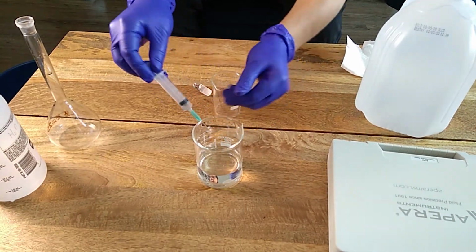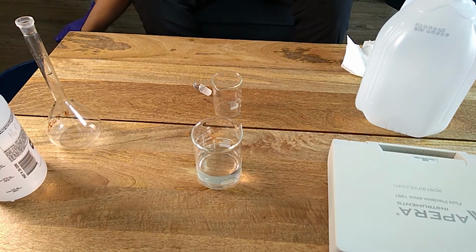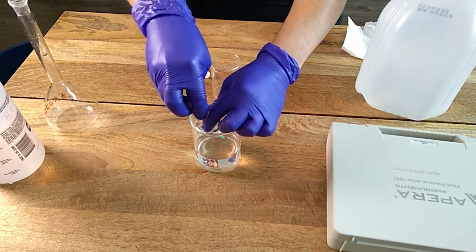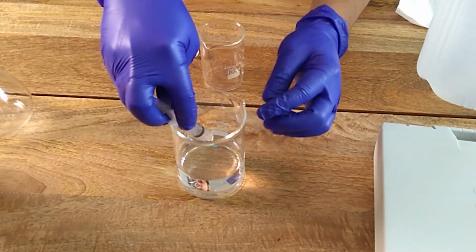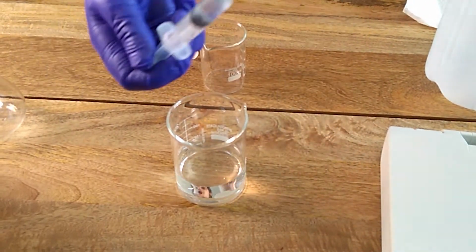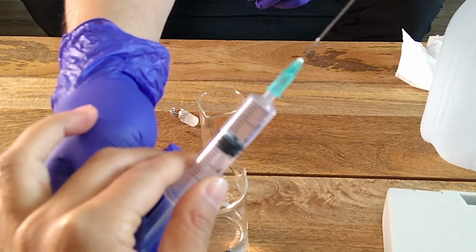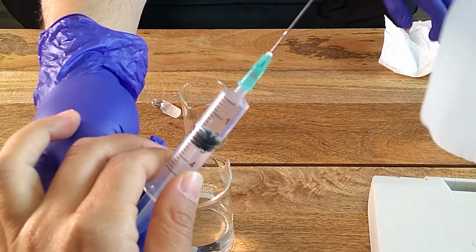Just take it up. So just purge the entire thing. Now that it's purged, we're gonna measure the volume that we want. So to do this, we want 2 milliliters. So I'm gonna draw slightly more than 2 milliliters. You can see here, I've drawn slightly more than 2 milliliters.